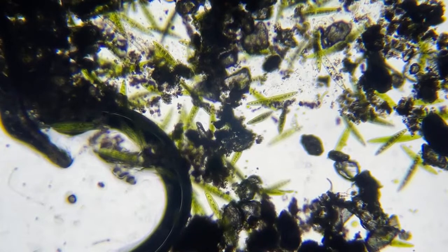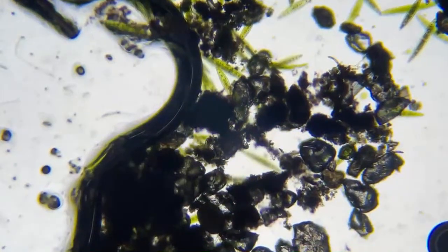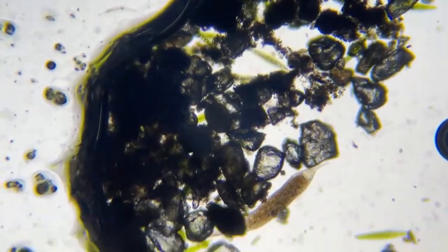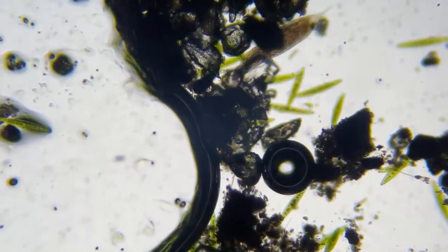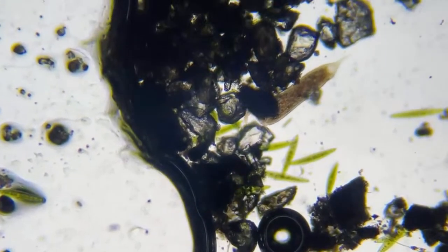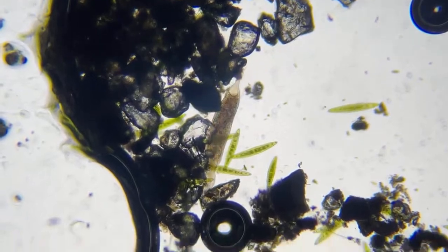Oh, Nemo said it looks much better. There you go. Sorry about that, Nemo, if I didn't see it. Navinod says slightly better. Okay, because from where I'm looking, right on my iPhone camera, there's no comparison. I'm seeing this hugely sharp.